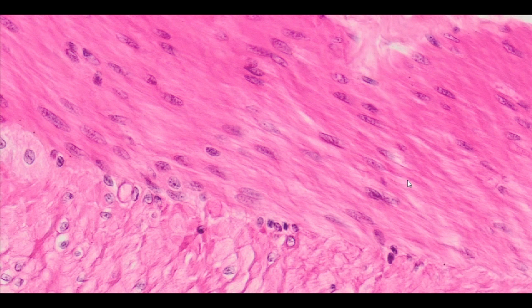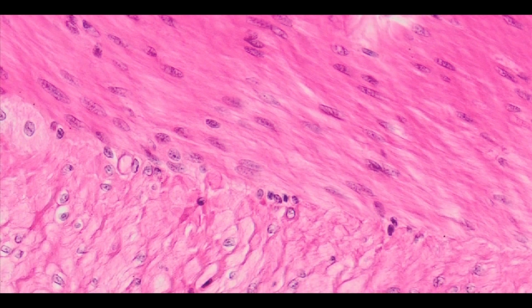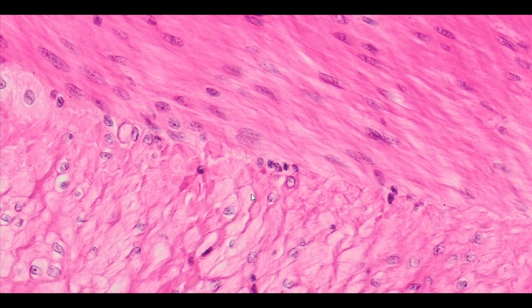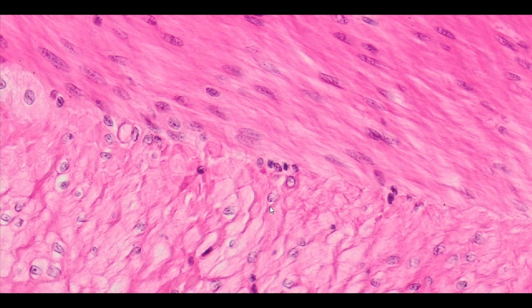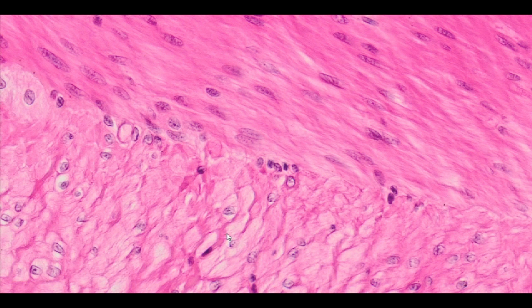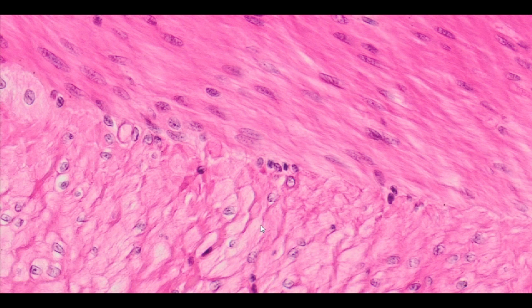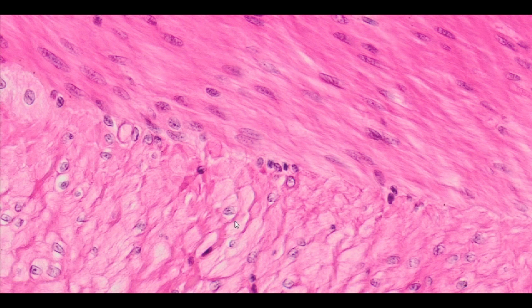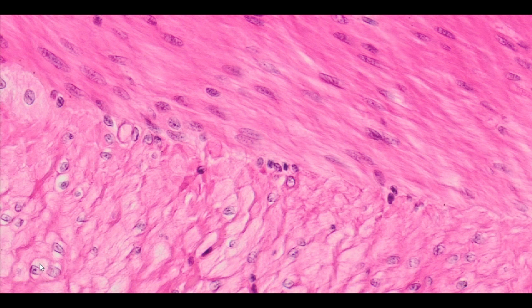A small amount of connective tissue is found between smooth muscle cells. In cross section, smooth muscle cells show spherical structures with significantly varying size, with a centrally located nucleus or with no nucleus. The multitude of different images in cross section result from the intersection of cells at different levels. A cross section through the apical part of the cell shows a small spherical image of cytoplasm devoid of nucleus, while sectioning through the central part reveals more abundant cytoplasm and a cross section through the nucleus at the center.